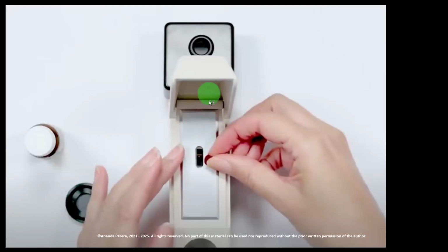Then after that, we have to close this. With some bigger stones, if it is a very big stone, we cannot put it inside the hemicylinder and close the cover. Without closing the cover, we can't check this. So we have to close the cover. If it is a big one, you have to take a single part after breaking the stone. You can break the stone into small pieces from the unwanted area. Then after that, polish one facet and take it to the lab. Then if you have the refractometer, you can use it here.